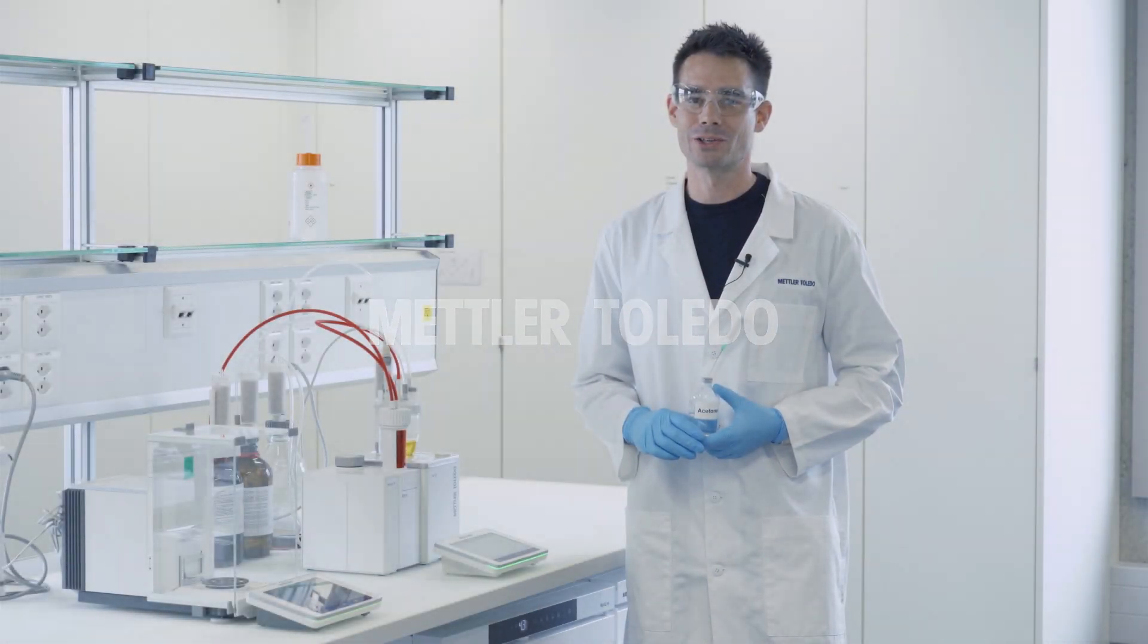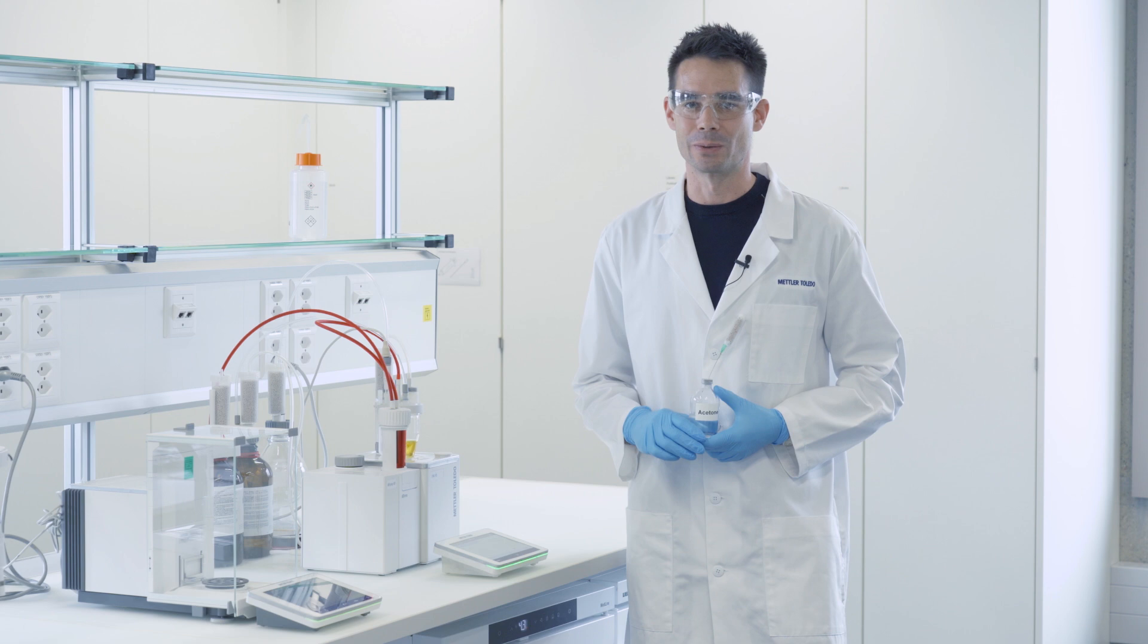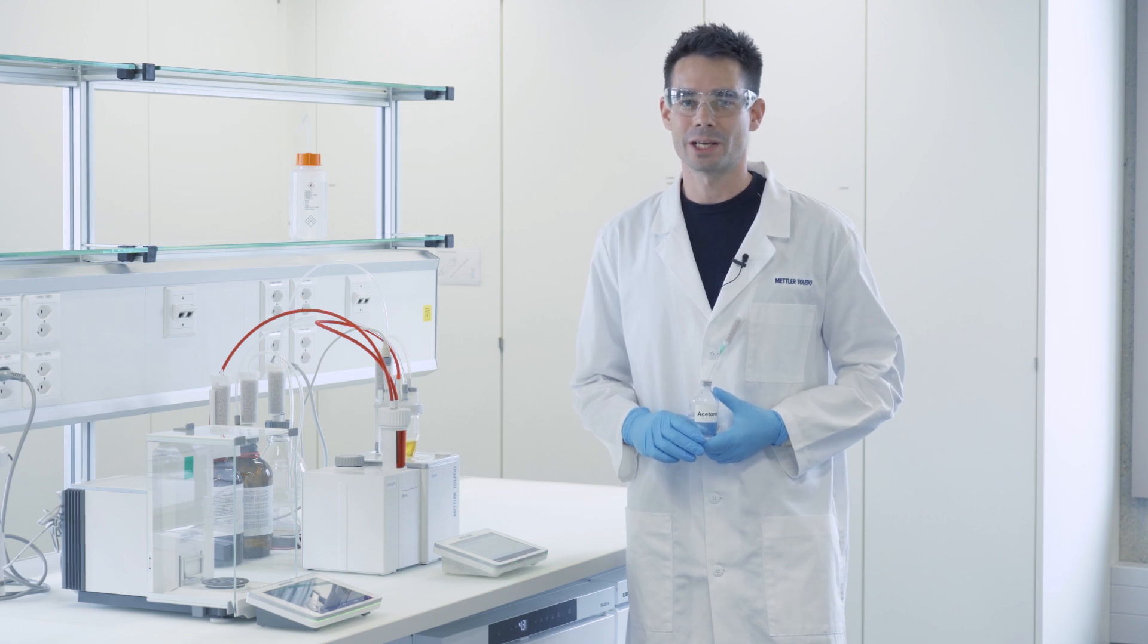Hello everybody and welcome to the application laboratories at Mettler Toledo. My name is Lukas Britsche and I'm applications chemist for titration.